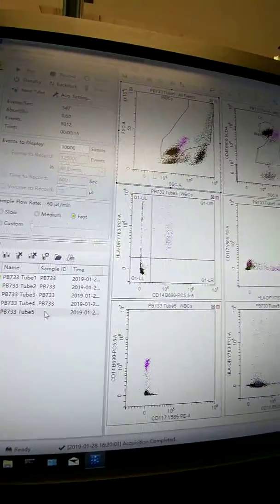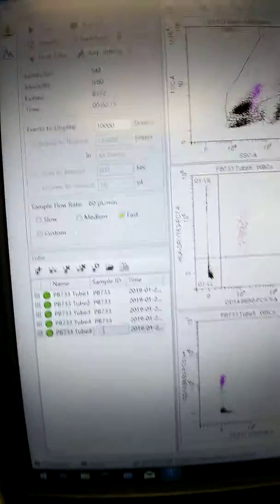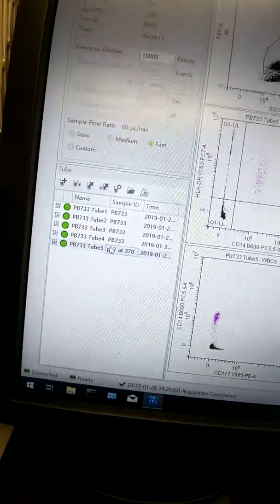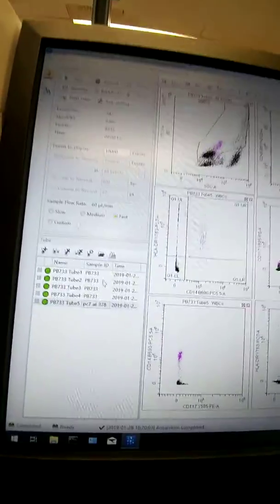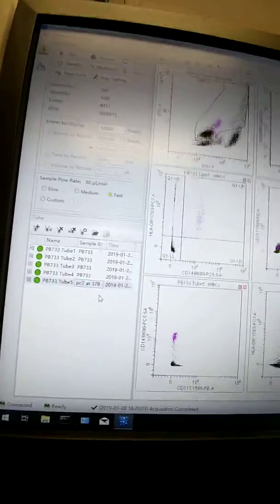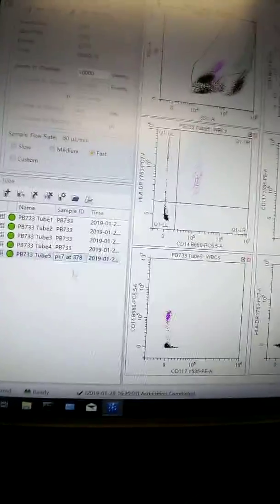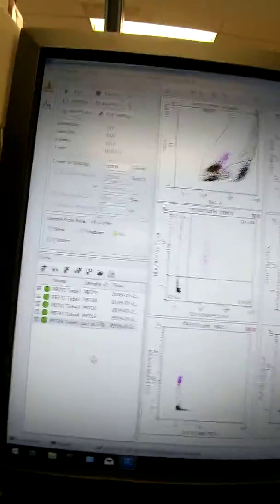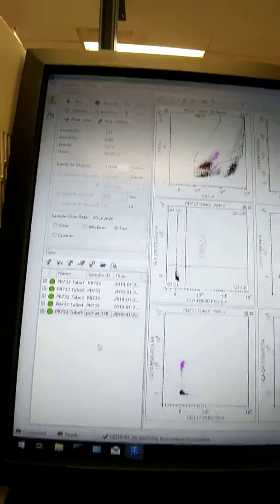Alright, and now that it's done, I'm going to put under sample ID that this is PC7 and now it's at 378. Okay, so that way we can load that file up into our analysis and see if it looks better. You could also run that tube again and put it at a slightly different gain setting. You could maybe adjust this up or down by 10 or 20 and then again save that, you know, whichever gain you changed and at what setting it is. And then you can look at the different files and see which one has the better gain.